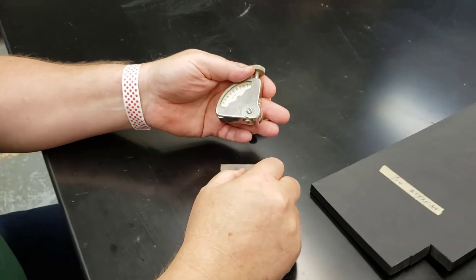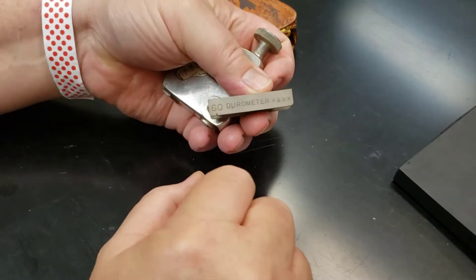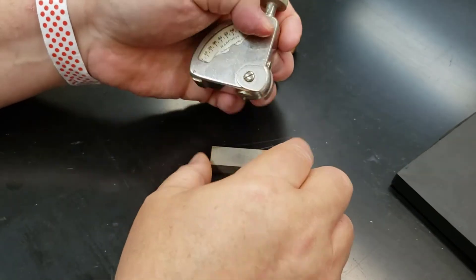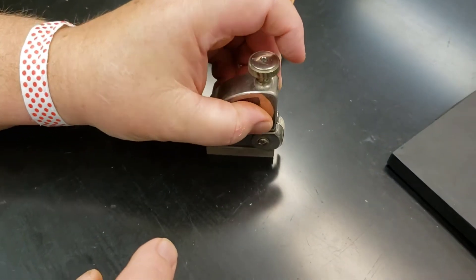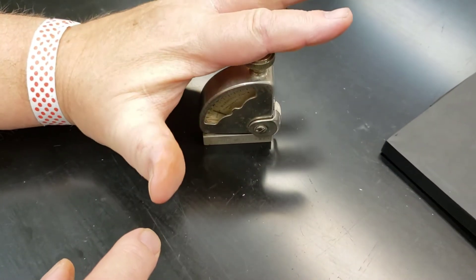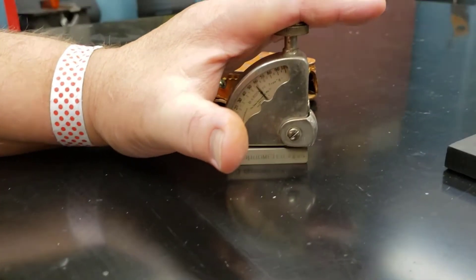The calibration block as you can see is set to 60 and what you have is this needle that sits and then you operate this by holding your hand down, pressing firmly, and then taking the reading.